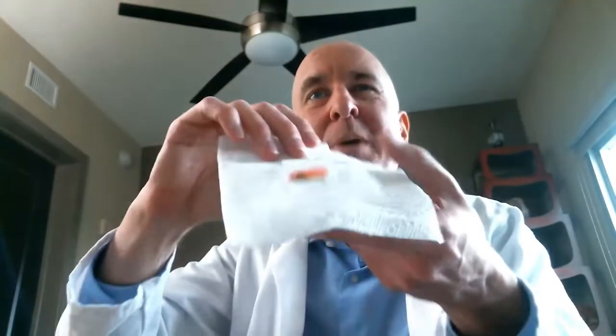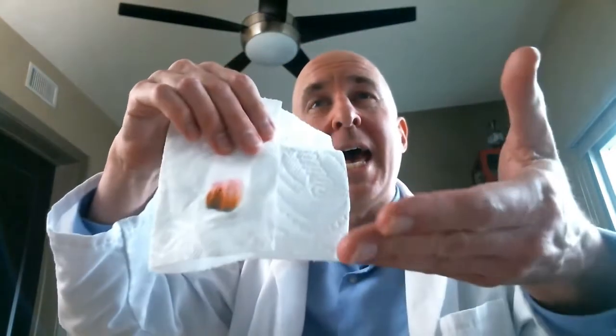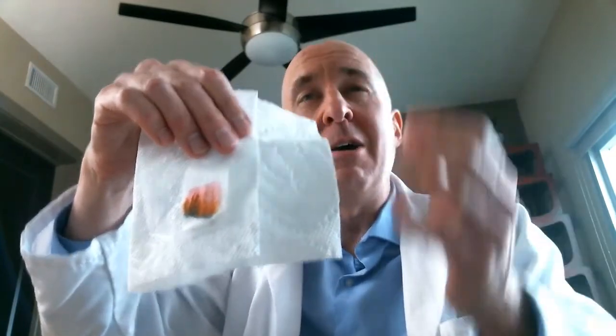Do you see that? This is the coffee filter paper. I had put brown ink on the coffee filter paper, and as the water is slowly coming up, it's spreading out all the different chemicals that make up the marker ink. And you can see that the marker ink is not just brown ink.